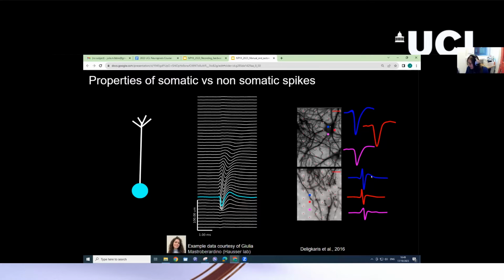And there are similar characteristics for axonal spikes. Again, the same data: these are example spikes recorded in different areas along a soma. And here are example spikes recorded along an axon. And you can see this triphasic shape with a very prominent peak before the trough.